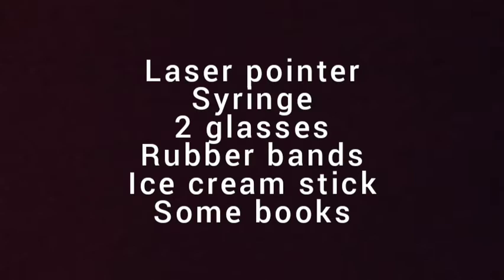So without wasting any more time, let's just jump into it. The materials that I used are on the screen.